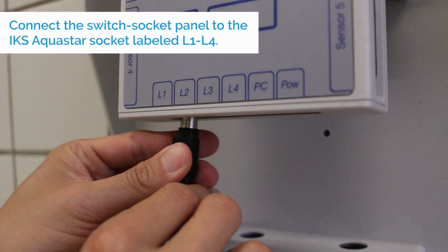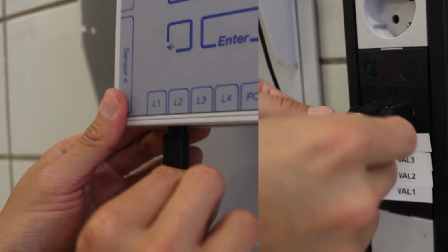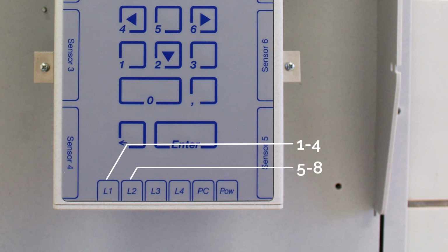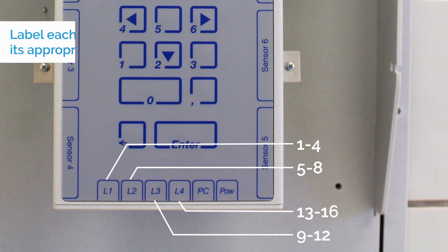Next, connect the switch socket panels to the bottom sockets L1 to L4. Sockets are numbered based on their connections to IKS. Numbers 1 to 4 are assigned on the sockets of L1, numbers 5 to 8 on L2, numbers 9 to 12 on L3, and numbers 13 to 16 on L4. To avoid confusion, label each socket with its appropriate number.